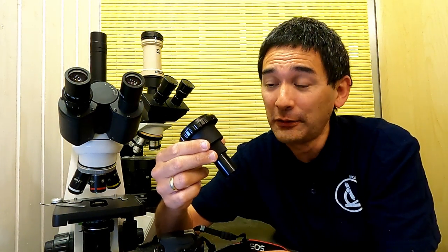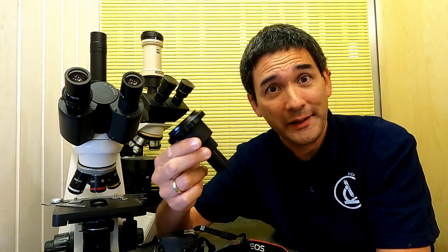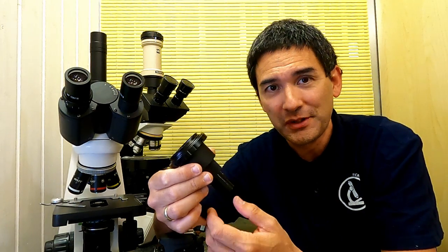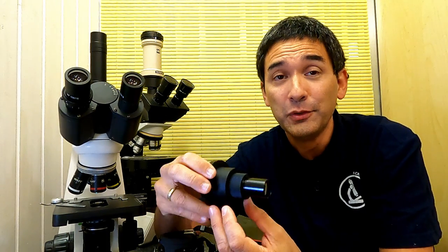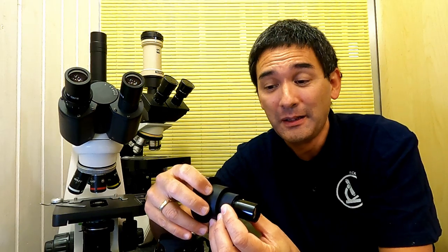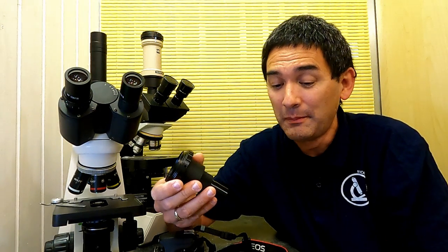Today I'm going to do a review video of this DSLR camera adapter, and I tell you, I almost feel like crying a little bit, because I'm not being sarcastic now. I think it's one of the worst adapters that I've ever seen, even though on the outside it looks pretty nice, but I need to explain it to you. And if you're new to microscopy and also new to this channel, maybe then I'll try to explain it in such a way that even people who are not so familiar with microscopes and adapters are able to follow here. I'm going to start at the very beginning.